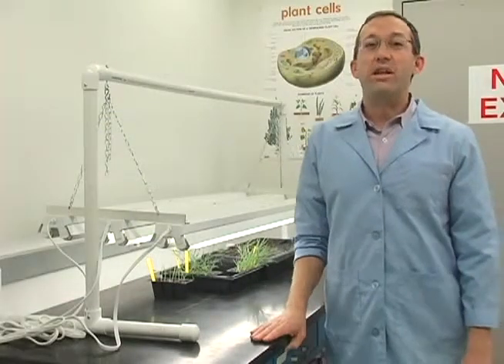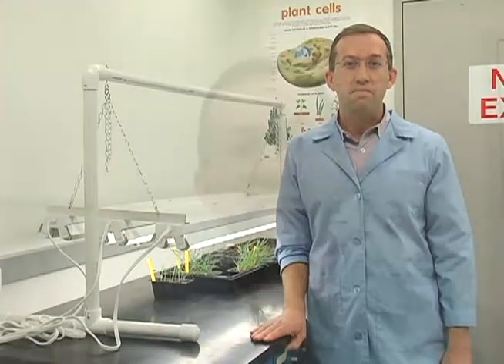Okay, it's been about a week now since you planted your seeds, and you should see the young shoots emerging from the soil. This is the process we call germination, and it's really the first phase of growth and development of the plant that we can observe. You should do 3 screenings or assessments of your plants as they complete their life cycle. This process should take between 4 and 8 weeks, depending on the environmental conditions of the classroom.